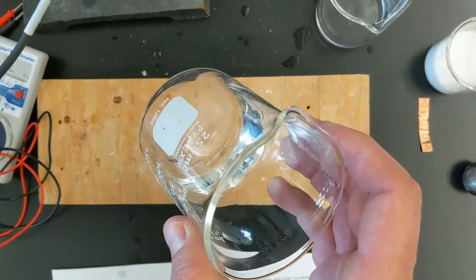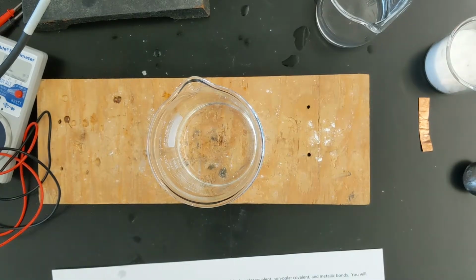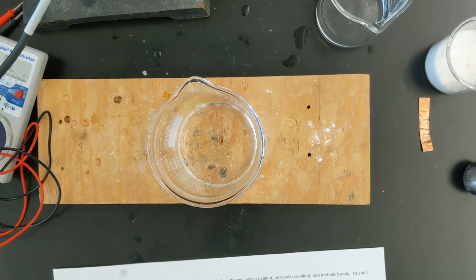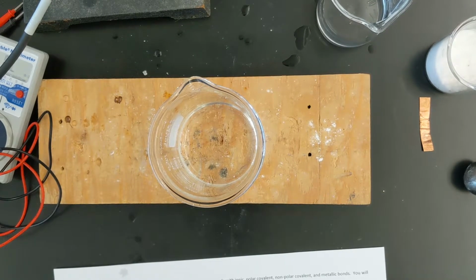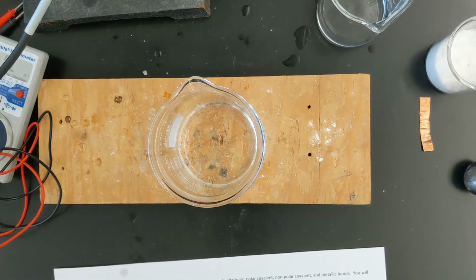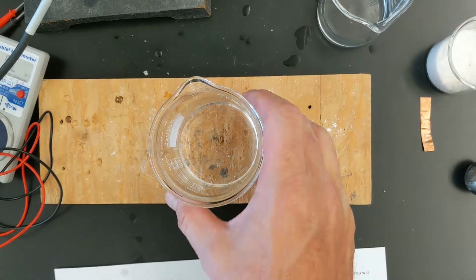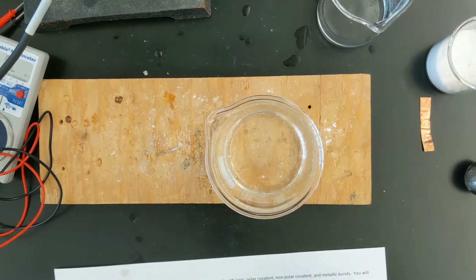Now for our phase at room temperature, of course, this is going to be liquid. For malleability, we're not going to test that because we only test malleability for solids. So you're going to write NA, or not applicable, for malleability. Same thing with conductivity of bulk state. We're not going to test the conductivity of this substance because it's not a solid. So we are going to test to see if it is conductive in solution.